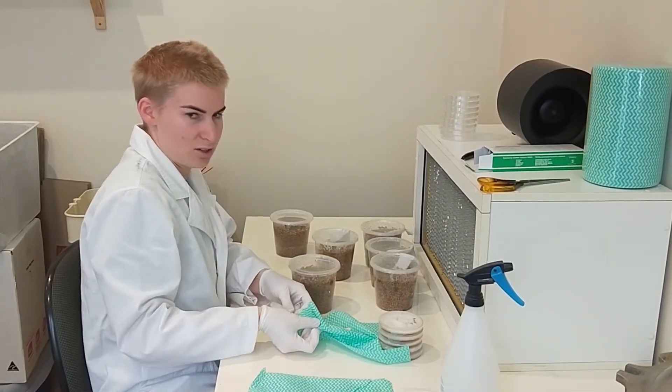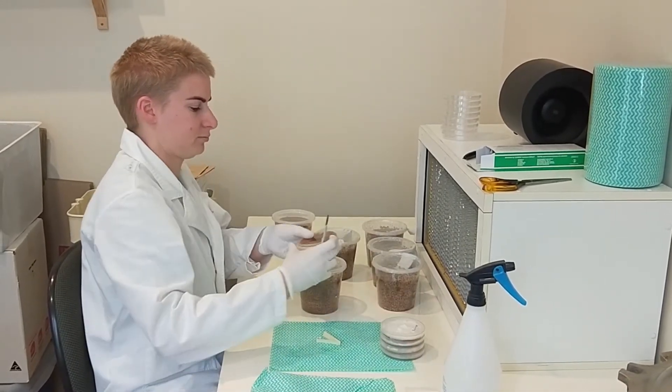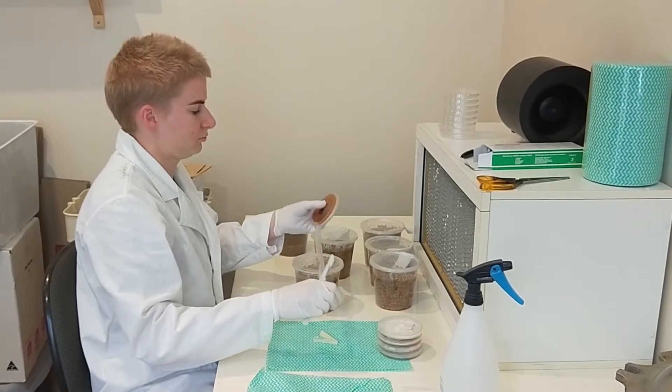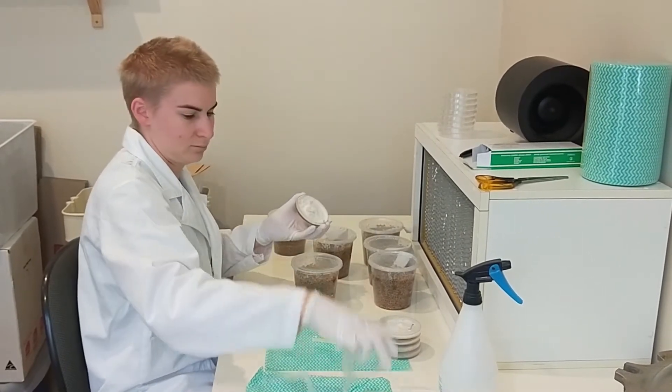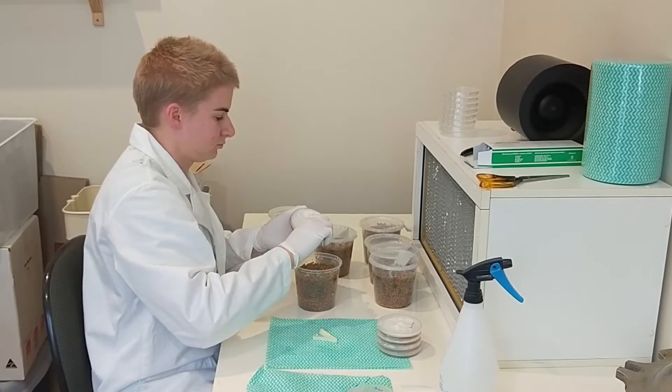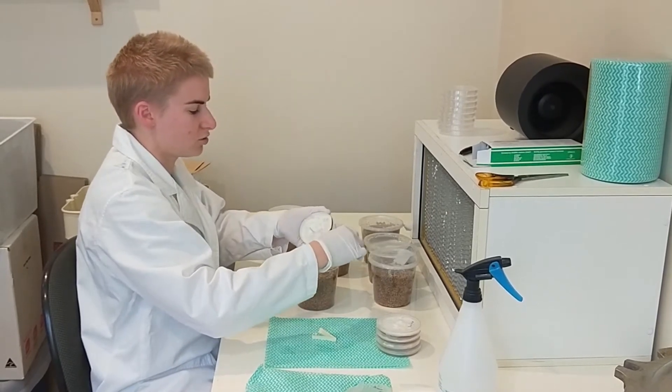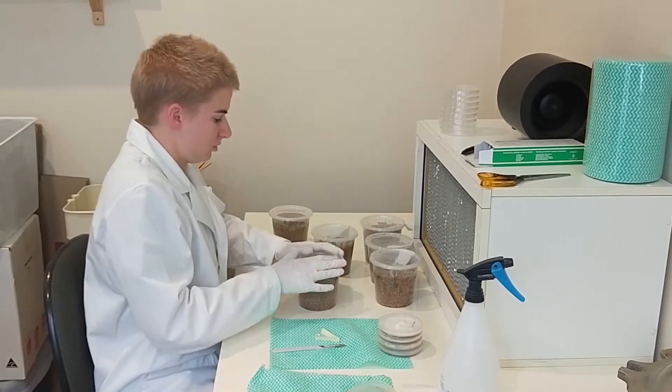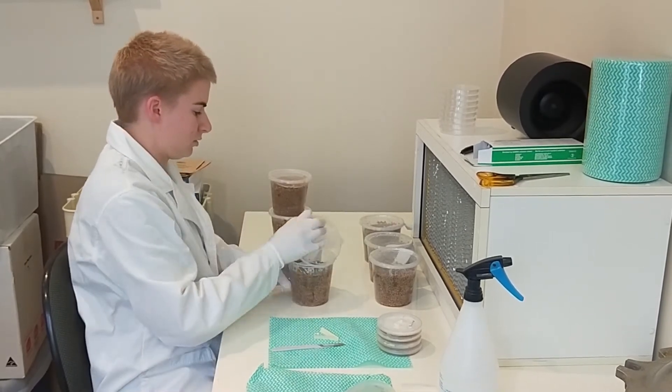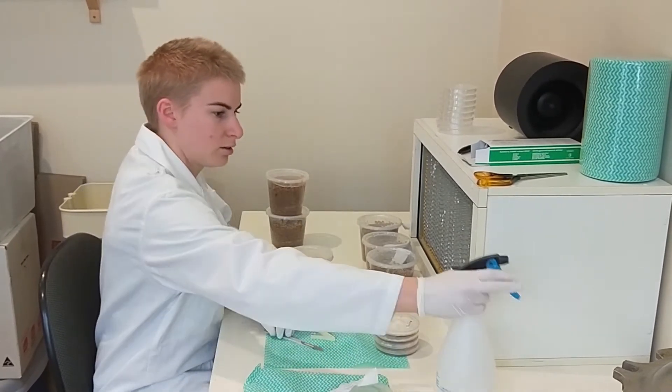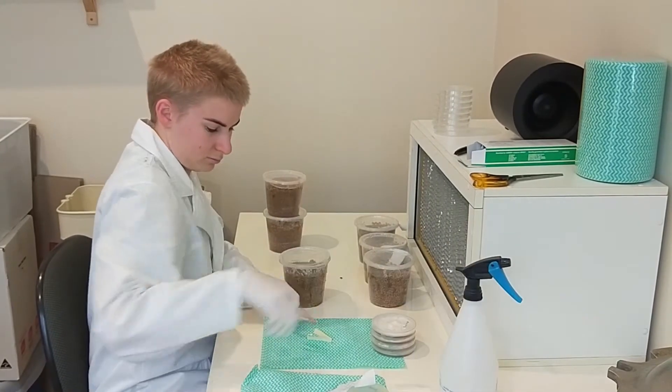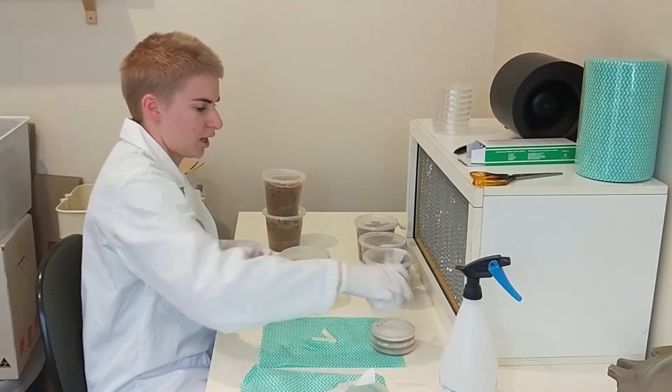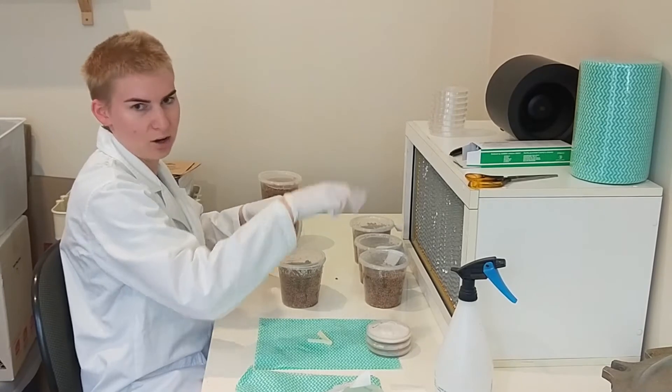A bit of methylated spirits in between, just to clean your blade. Just sort of prise it along the edge, you can just pull the whole agar off as a whole. And just make sure you stay within that sterile workspace as well.